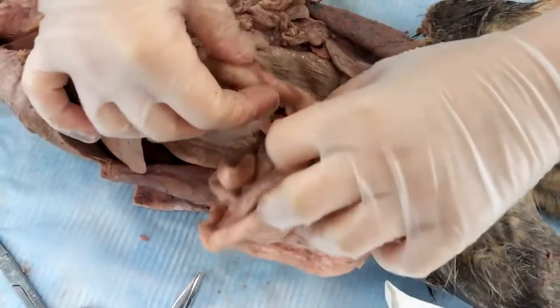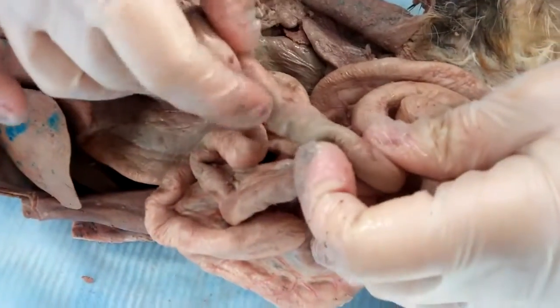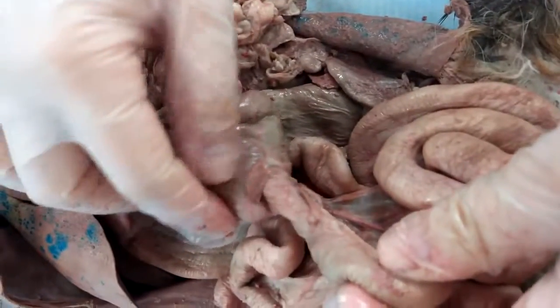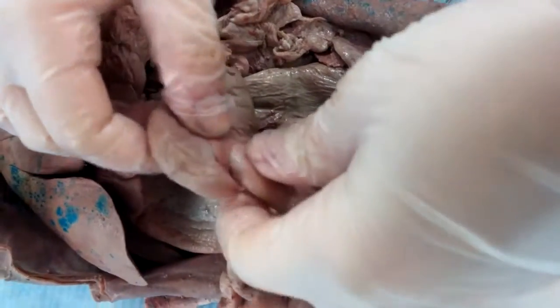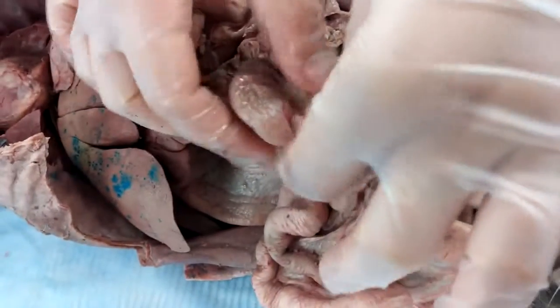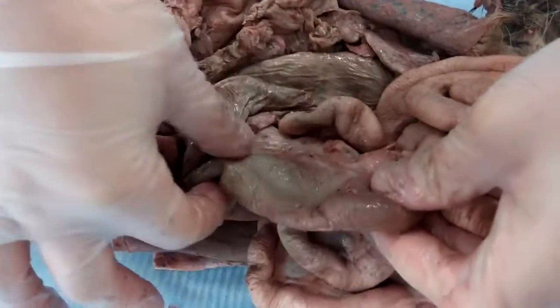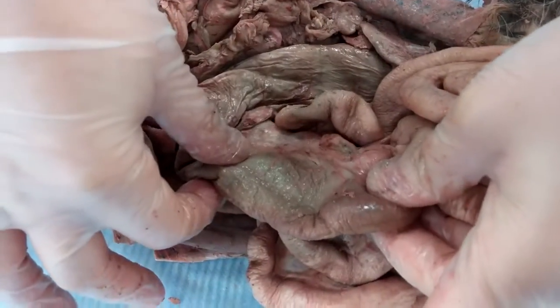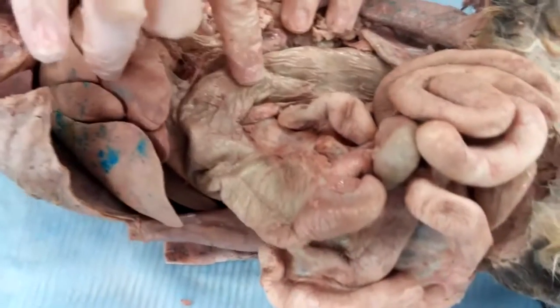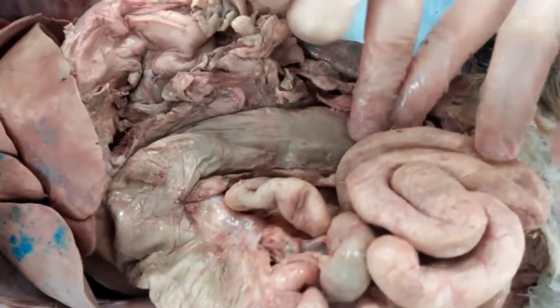Right here we have the cecum. You see that? It looks like a teardrop or something. So that's the cecum. This right here, coming upwards, is the ascending colon. Coming across is the transverse colon. And then going down is the descending colon.